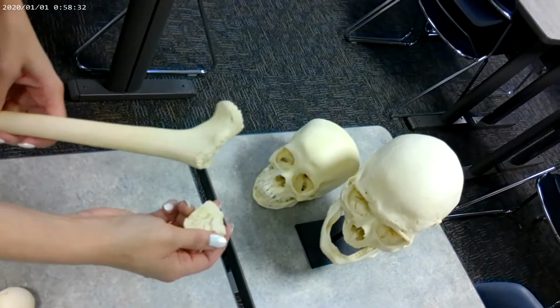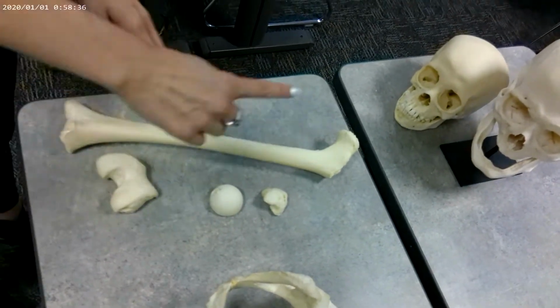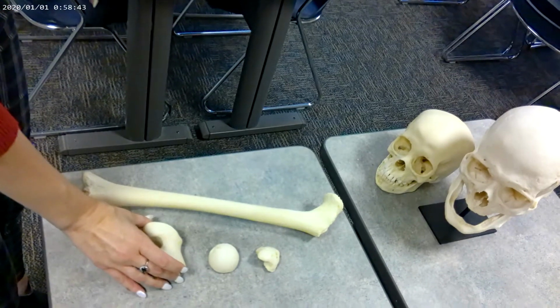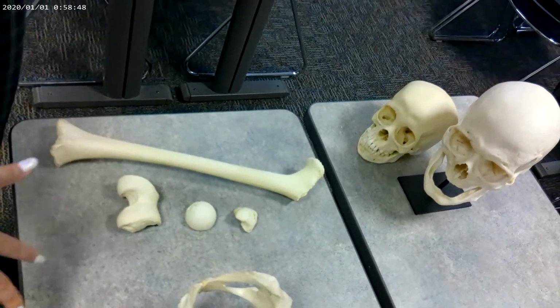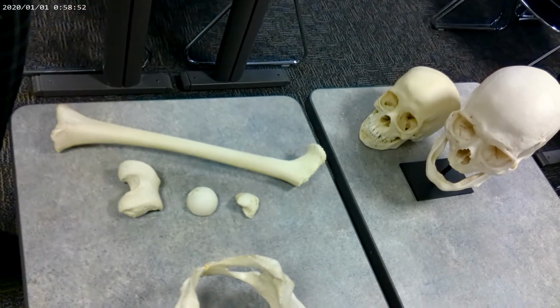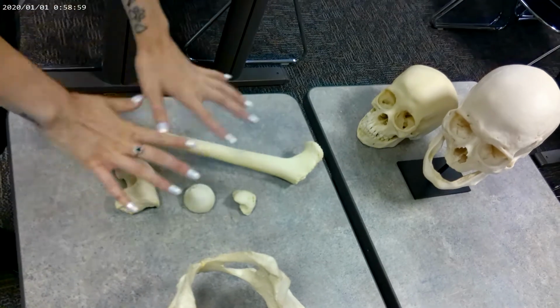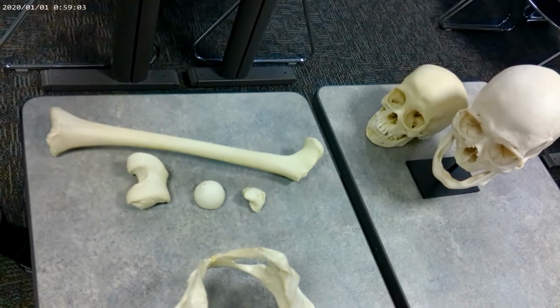If we saw these remains, we would know this person is a very young individual because this is not a broken bone. This is a growth plate that has not fused yet. So you have a nice chart in your book, and we'll practice this. If they are completely unfused, they are going to be at the lowest age on that chart. If they are completely fused, they are going to be at least the oldest age on the chart. And if they're somewhere in between, then they're somewhere in between. Okay, so this would be the lower age range because this person has not yet finished growing.